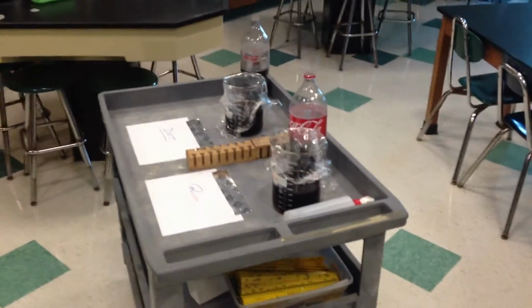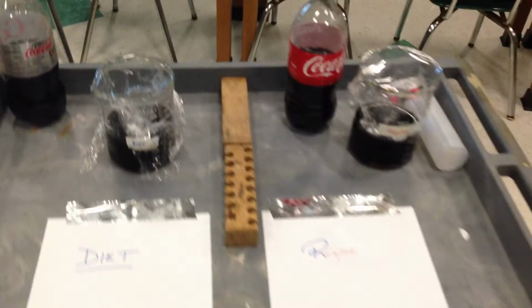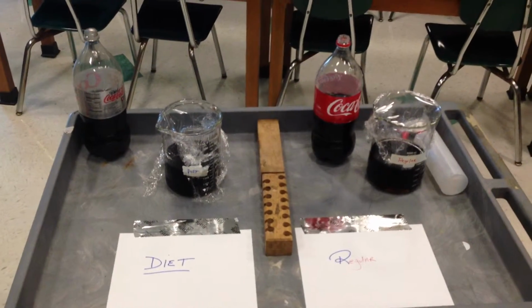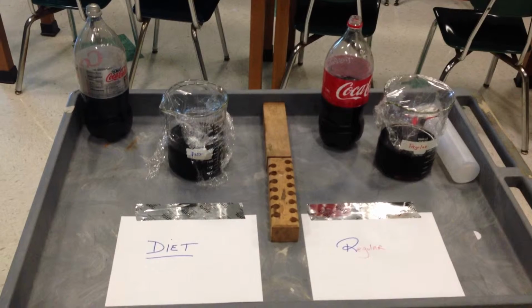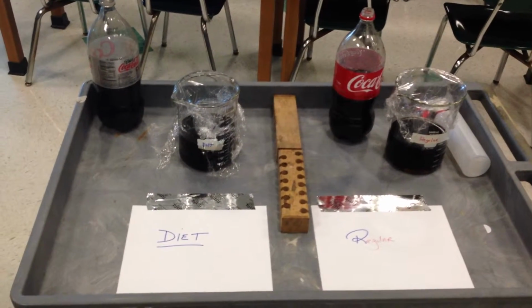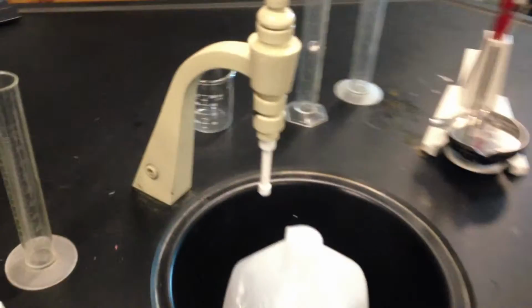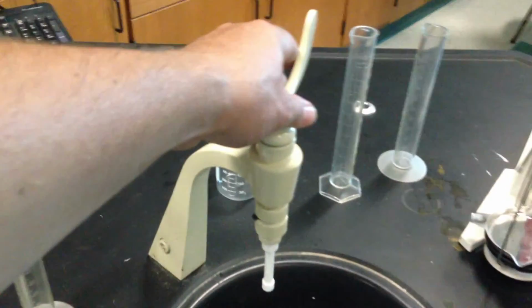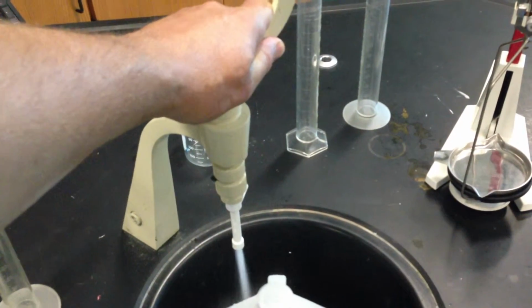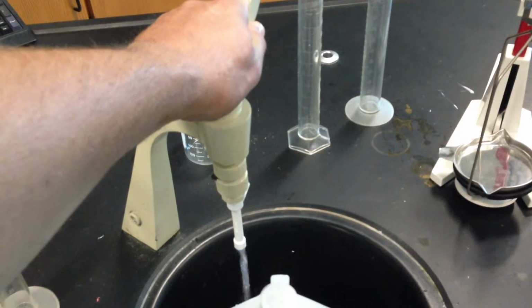So in the back of the room we have this gray tray, and this is going to be our reagent table. We have three liquids we're trying to get the density for, so it would really be prudent if we stagger which liquids we start with. So one table or two tables can start with Diet Coke, another table can start with regular Coke, another can use water. And when we're using water, if you're using the tap water, make sure you turn this on slowly, because too fast it's going to come out like a jet and spill all over. So turn it on gently to fill up your container.